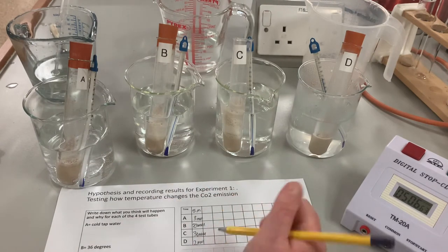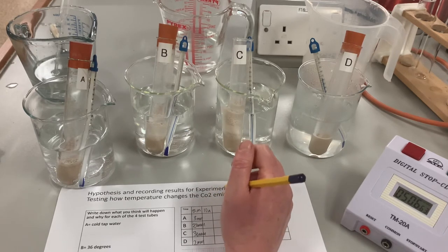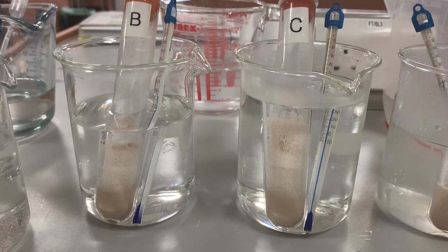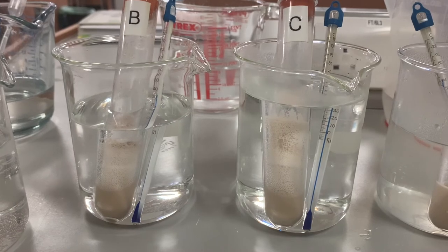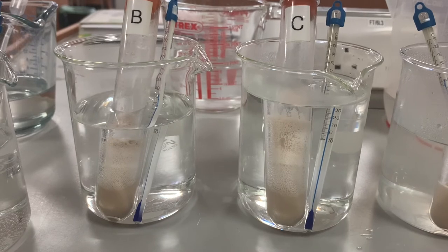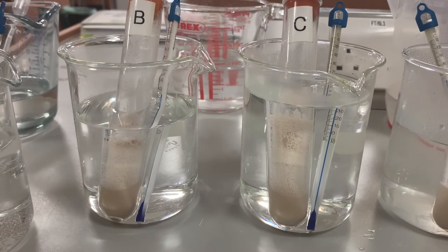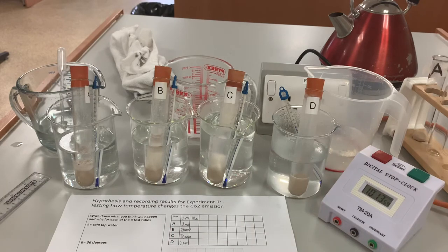I've got my first set of results. I'm going to start the timer again for another five minutes. If we look closely at sample B and sample C, we can see the bubbles being produced. The foam is quite tight in B and quite lively in C. Whether this changes the growth lines is something we'll look at at the end. After 10 minutes, we're going to have a look at them again.